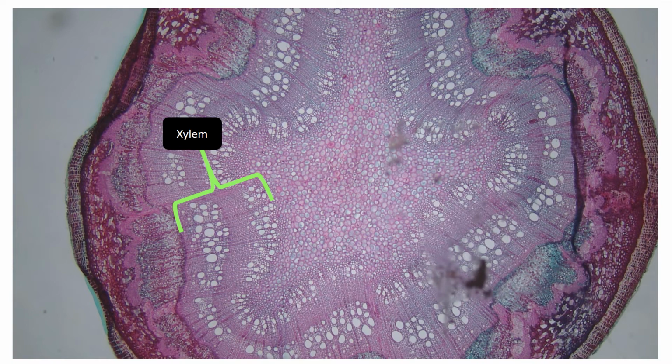And so this is our xylem. There's actually some unique things going on with the xylem we are able to see in this one compared to the pine, and that is the presence of different layers of growth. And so when it comes time for plants to grow, there's early growth and late growth, representing a growing season, and also rings can form, allowing you to age trees potentially in the right environments. As long as conditions are good and they're growing in the right area, you can see these sorts of things. In this case, we can get a hint of it. And there is our first year of growth.